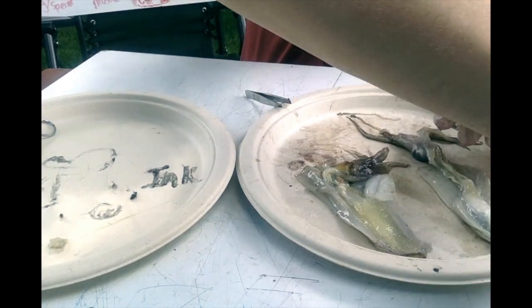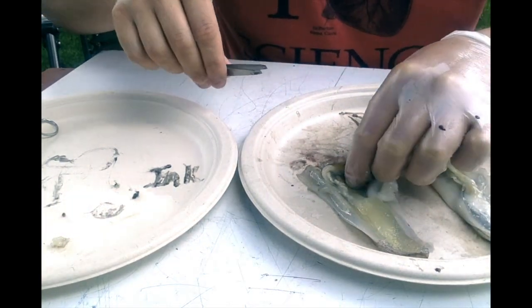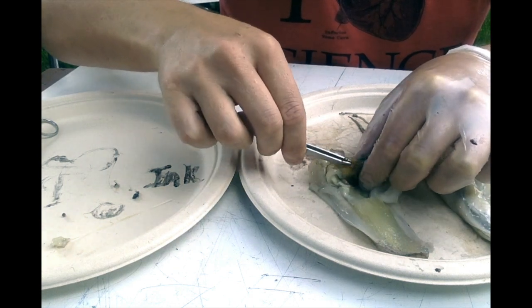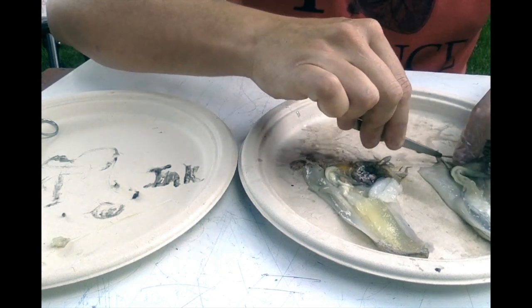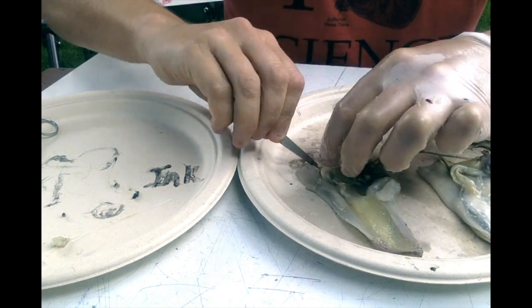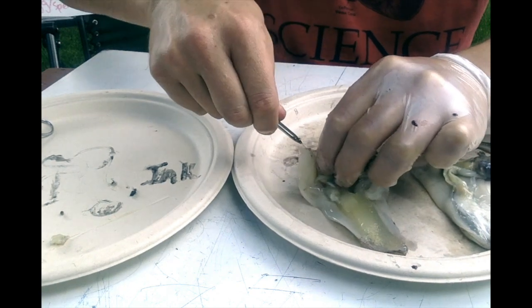We'll get the squid juice off of this part. All right, the eye juice. And so the pen is this rigid structure here. I just cut part of it. I just snipped. If I flip my squid over and I just snip right here, you can see that's where the pen is. And I should be able to just pull it out of its body. This part's pretty cool. Ready?